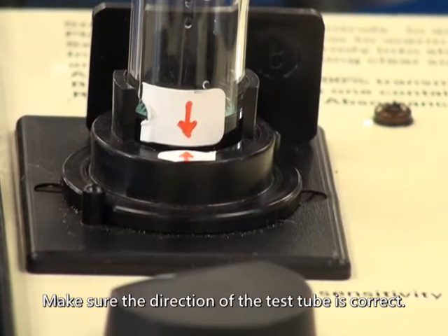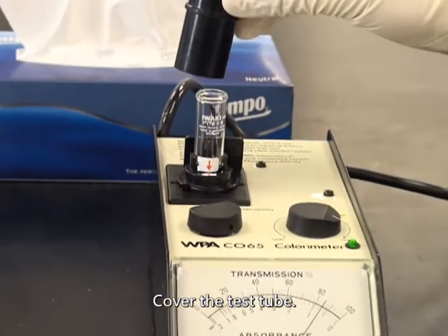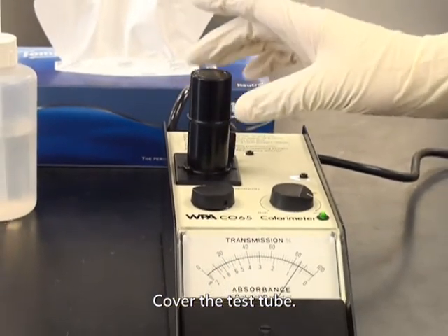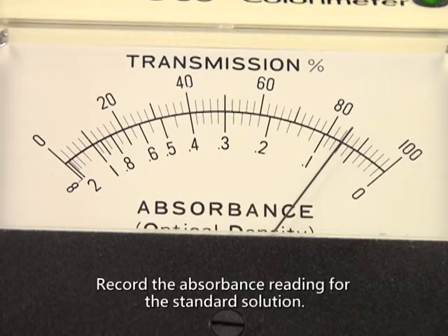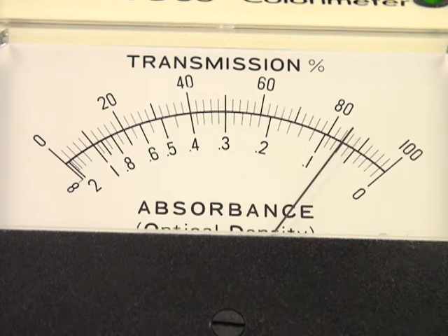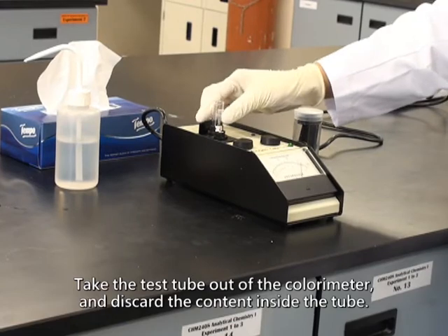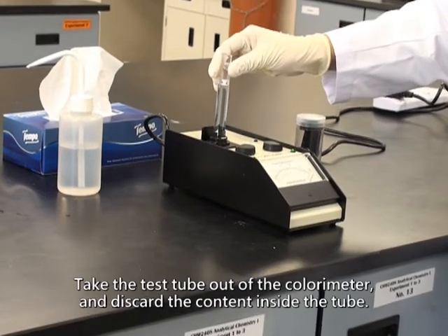Make sure the direction of the test tube is correct. Cover the test tube. Record the absorbance reading for the standard solution. Take the test tube out of the colorimeter and discard the content inside the tube.